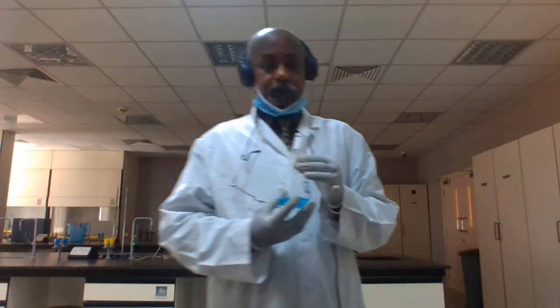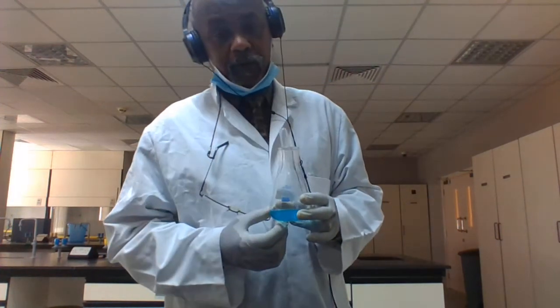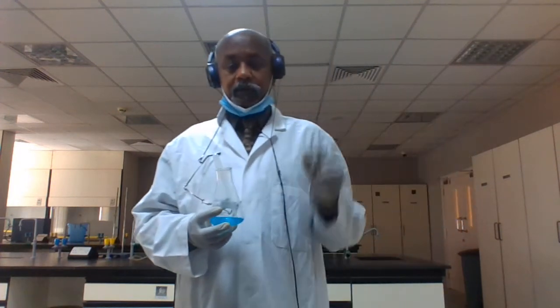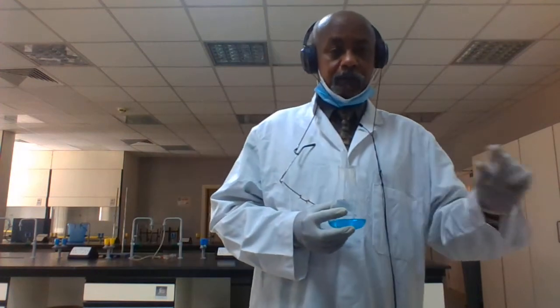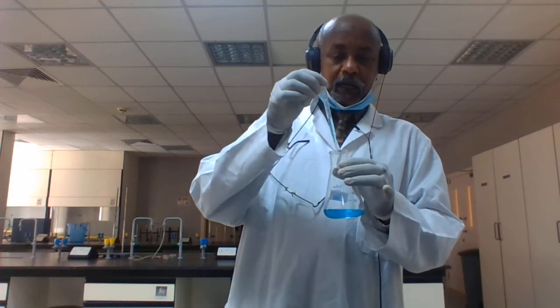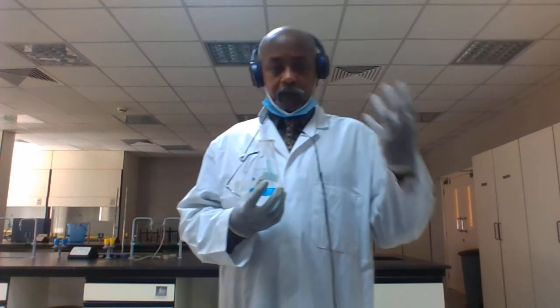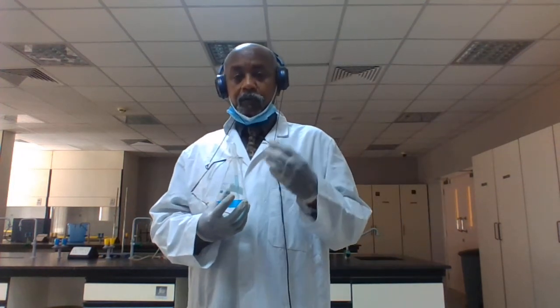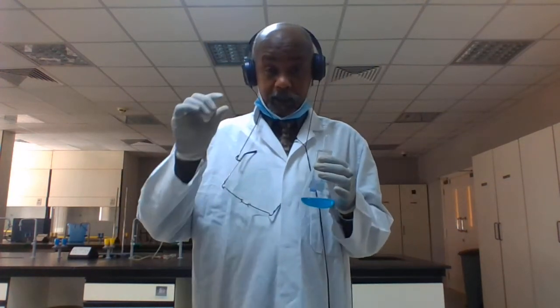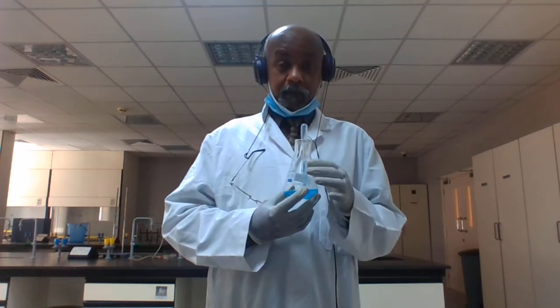It is used to identify whether monosaccharide is present or not. Take a known volume of your sample in a test tube, then heat it and add Benedict's. When you add the Benedict's to your sample, the color will change to pale green. When this pale green color is present, that means your sample contains monosaccharide.